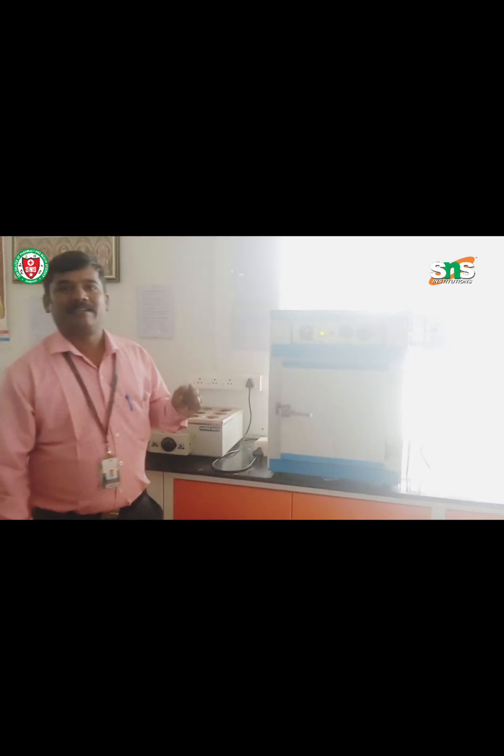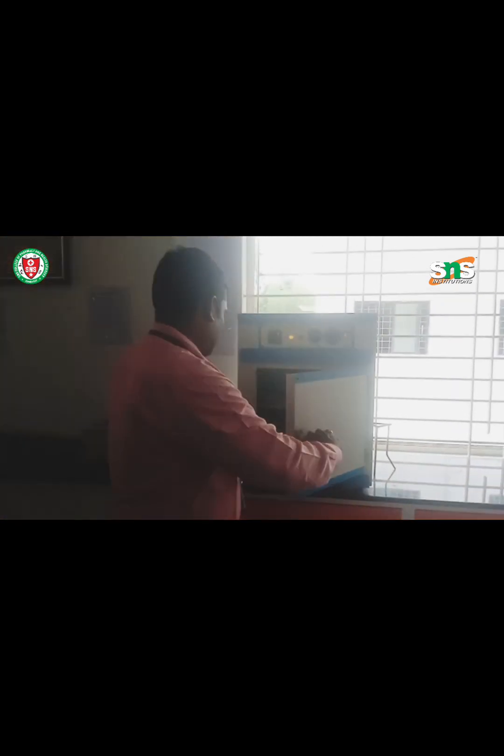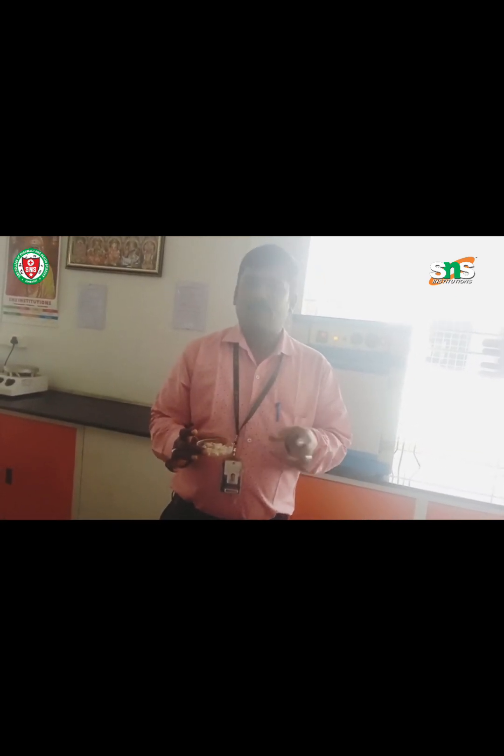We have kept it for drying. The drying has been completed — we will check the product, whether it is dried or not. Yes, this is our synthesized product of benzanilide. We got the product. So, benzanilide is prepared by adding benzoyl chloride and aniline in the presence of 10% sodium hydroxide. You have to be careful while adding this benzoyl chloride, because it causes irritation to the eyes. I hope you could understand the steps involved in the preparation of benzanilide. Thank you very much.